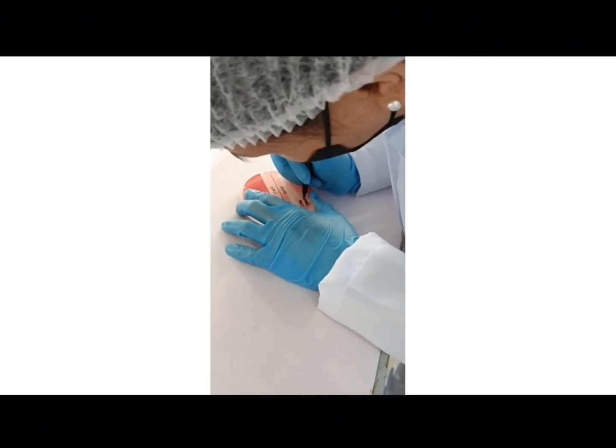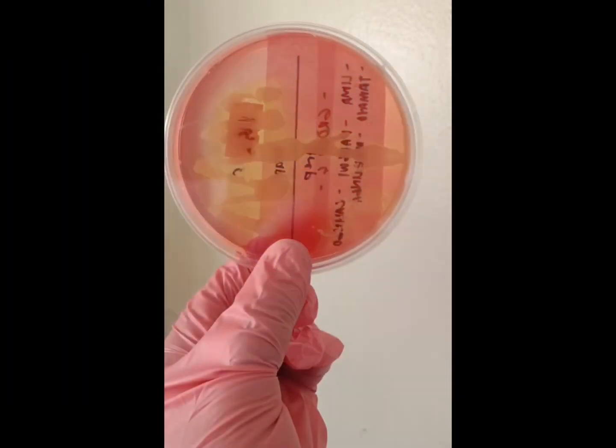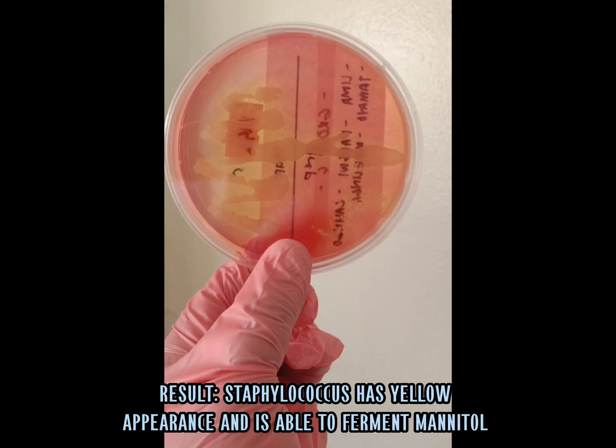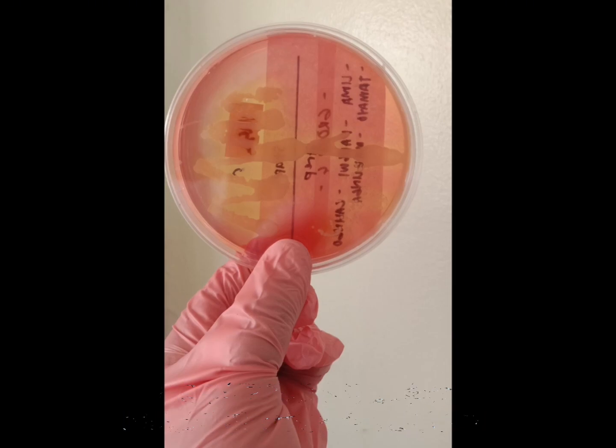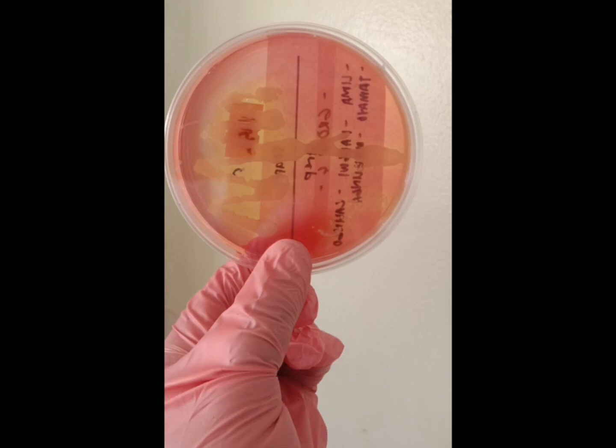Incubate the MSA at 37 degrees Celsius for 24 hours. After incubating it, we can see here that our Staphylococcus grows in MSA and appears yellow. Therefore, we can conclude that Staphylococcus was able to ferment mannitol. On the other hand, Streptococcus also grows in MSA but appears pinkish. Therefore, we can conclude that Streptococcus can't ferment mannitol.